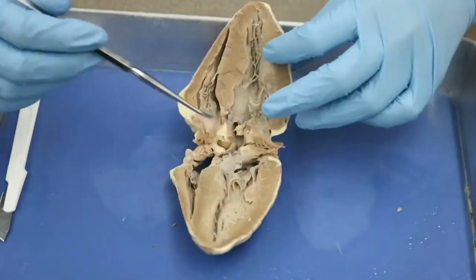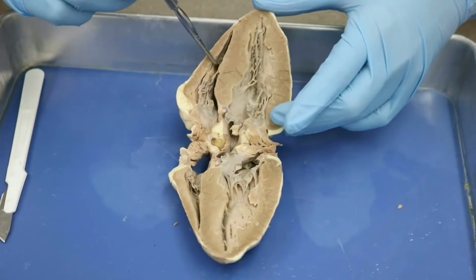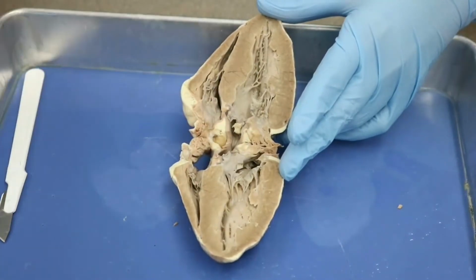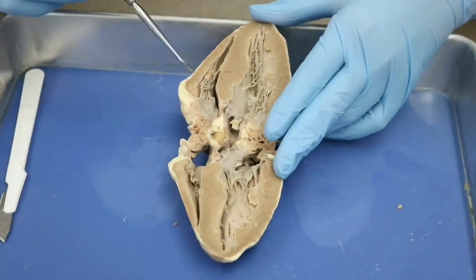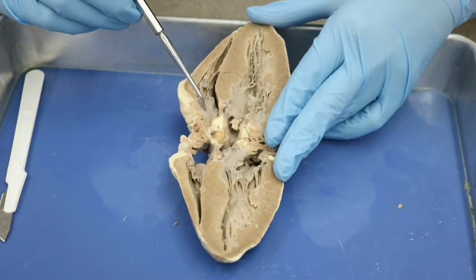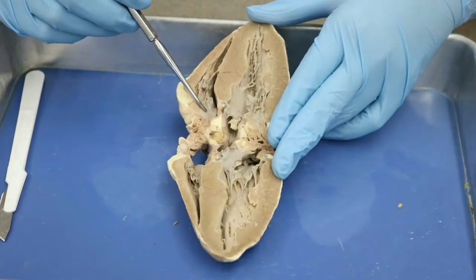Remember, we've just flipped the heart open, okay? So right atrium on either side here. This makes this our right ventricle, and then we have our left ventricle on either side here, and our left atrium on either side here, okay? And we can also see that, it's probably better on this side, we have our chordae tendineae again on this side, a little papillary muscle there, and so that makes this valve that is going from the right atrium to the right ventricle, this valve has got to be your tricuspid valve.